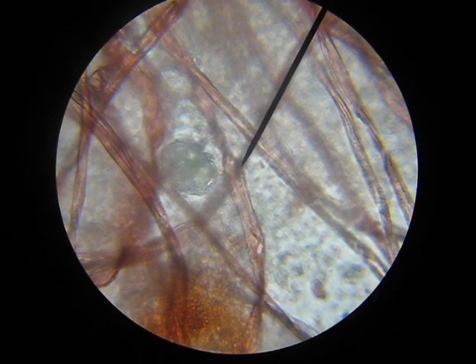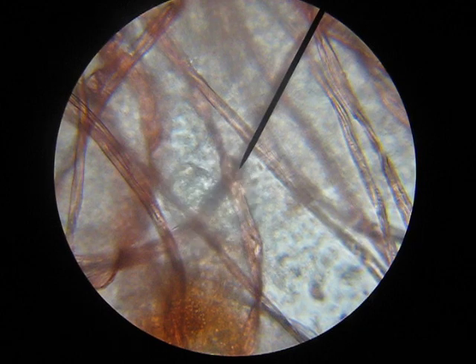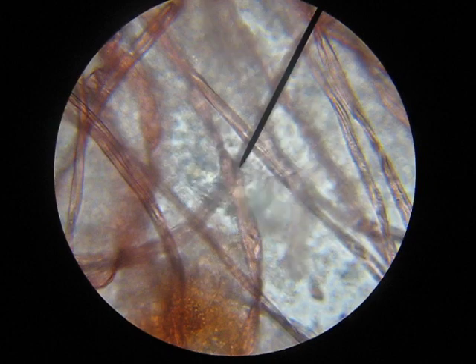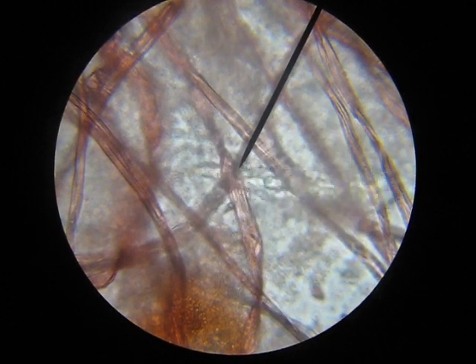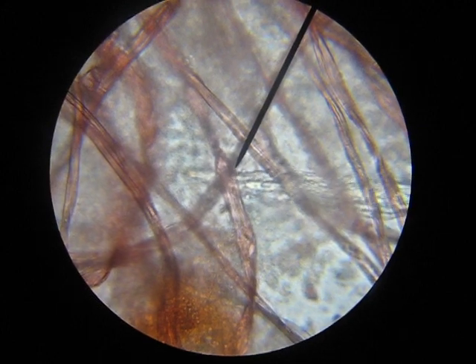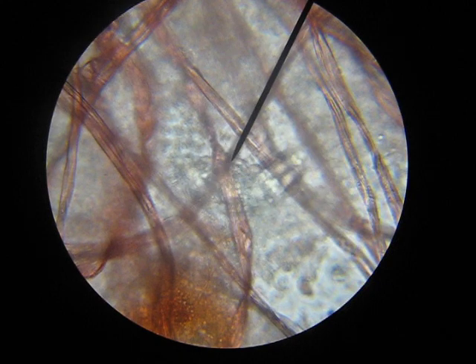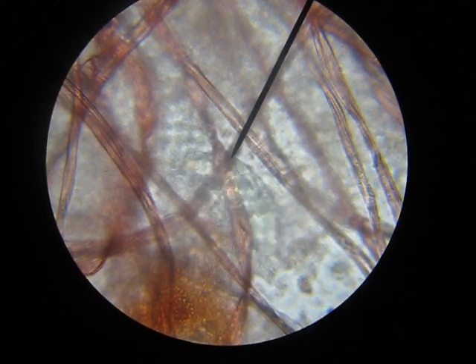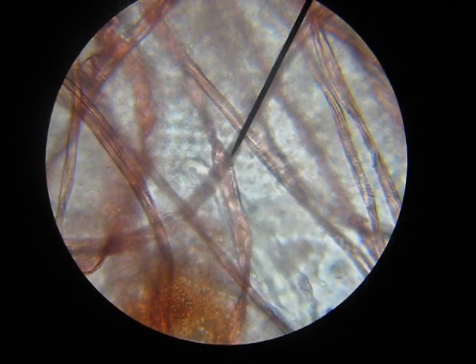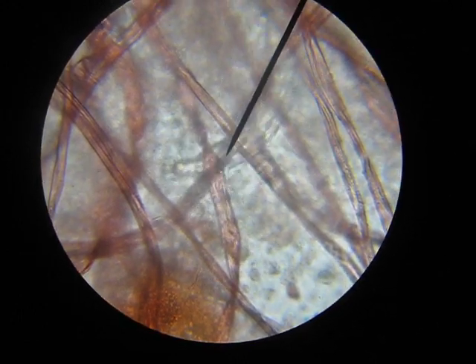I tried to have this student here look at it. He said he sees two. But what I can do — that's really hard to get it trapped with that cotton. It is. This one is finally trapped. Here we go. They have like four of them really, really eating, really, really trapped. Can you move the slide just slightly so that we can see he's eating right there? So maybe leave it now, maybe a little bit away, right? So that way. Maybe it's okay where it is.